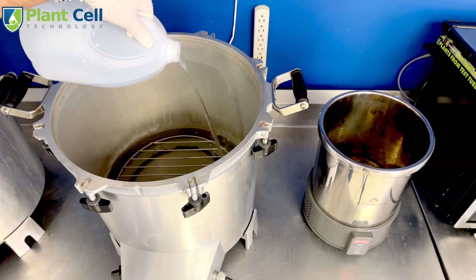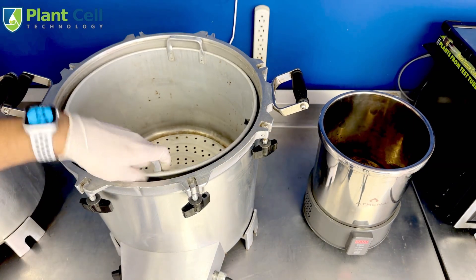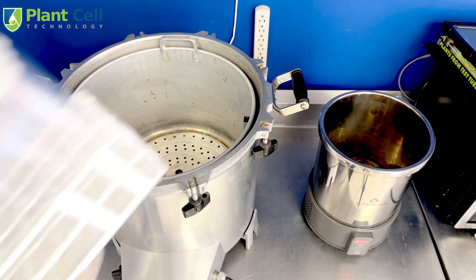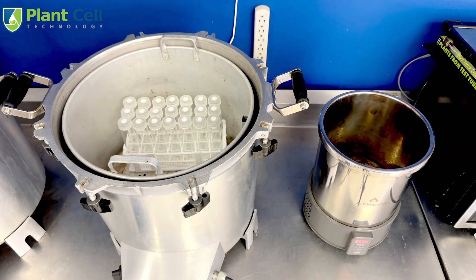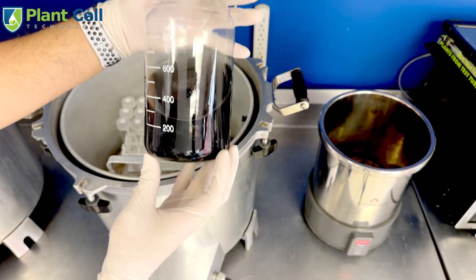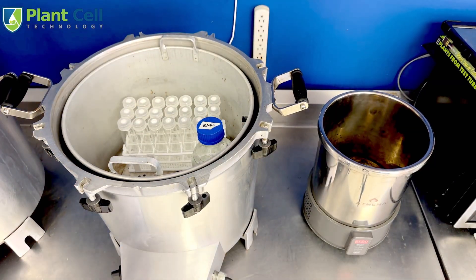That makes the All-American much slower because it takes a while to heat all of that water and build pressure. So in the lab I use the Athena sterilizer for most of my work, except when I'm doing very big loads. To fill it up, for example, I'm using these test tubes — they are empty — and I'm making my media in a media bottle.